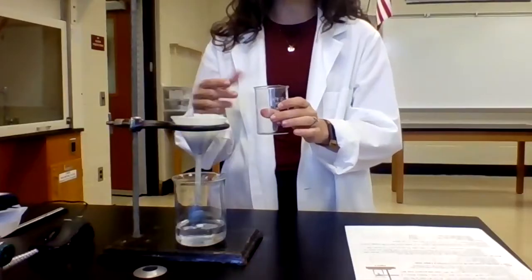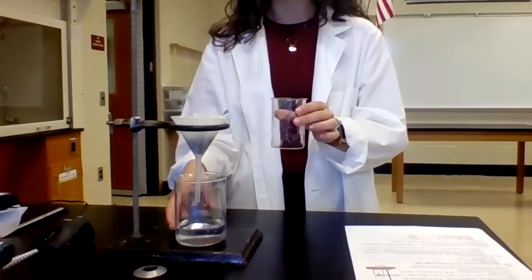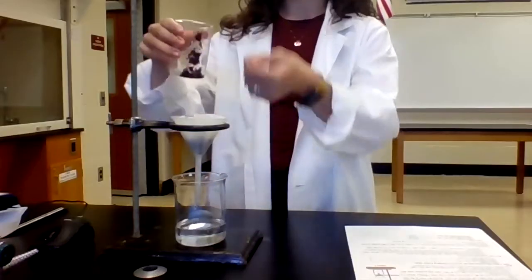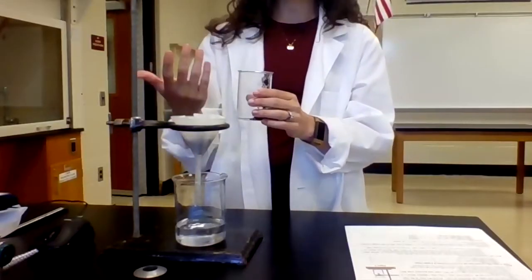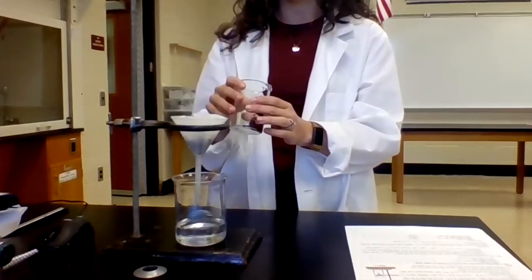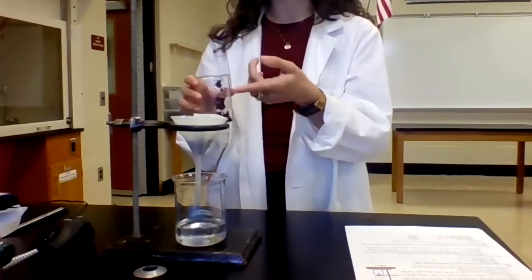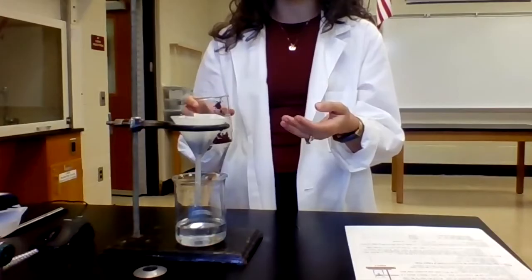This is my product. I need all of it to get onto the filter paper. So what I'm gonna do is I'm going to use, this is what's called the filtrate. I'm gonna use the filtrate to rinse the beaker so that I, again, can do my swirl and transfer. Probably have to do this 2 times, maybe even a third, depending on how the transfer goes. It's really important that I get all of my product onto this piece of filter paper. Otherwise, I'm not gonna get the correct empirical formula.